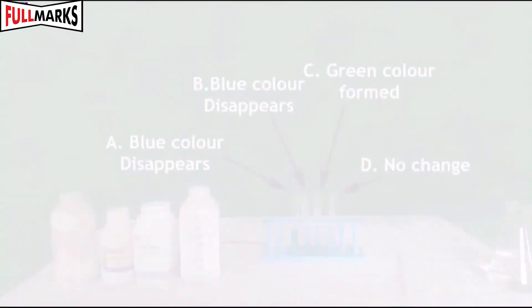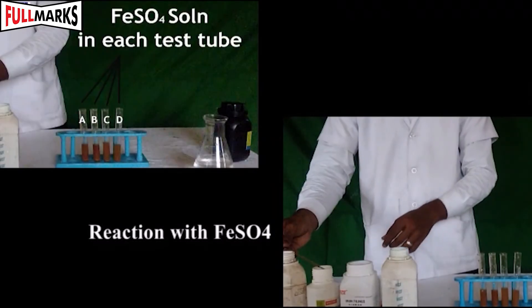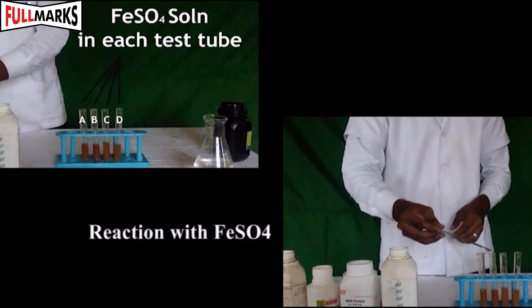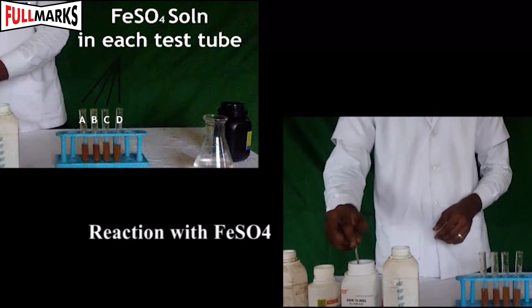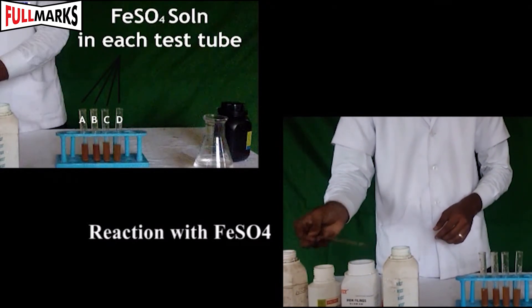Reaction with FeSO4 solution: Now take iron sulphate solution in each test tube.